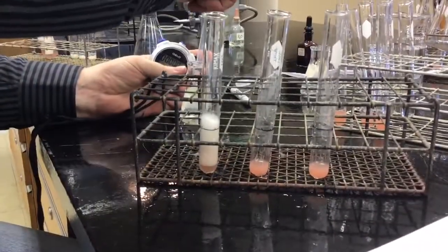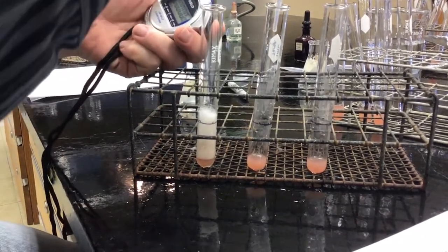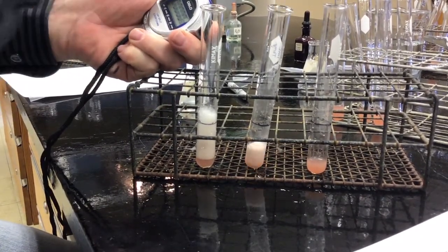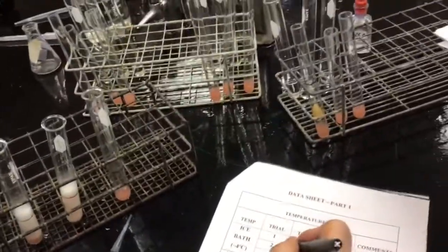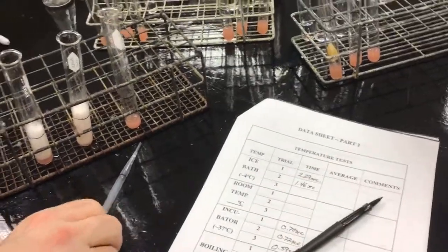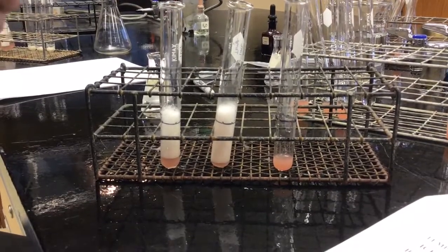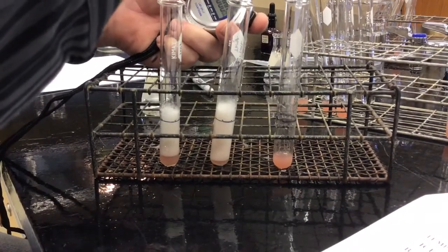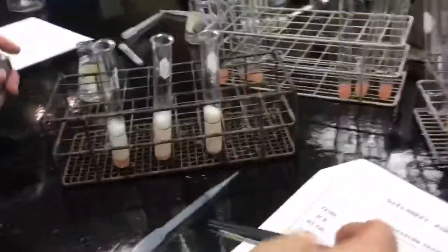Trial number 2. 1.46 seconds. Number 3. .34 seconds.